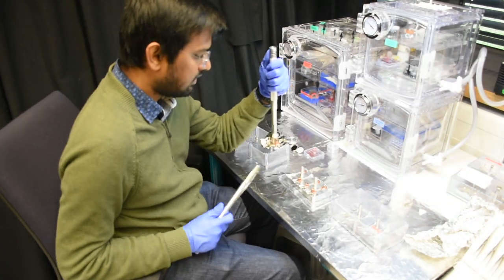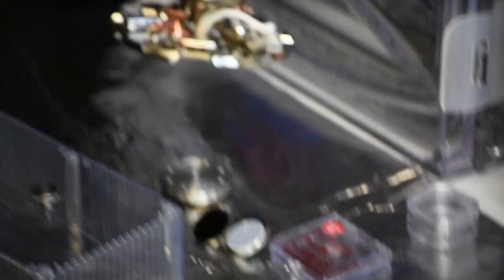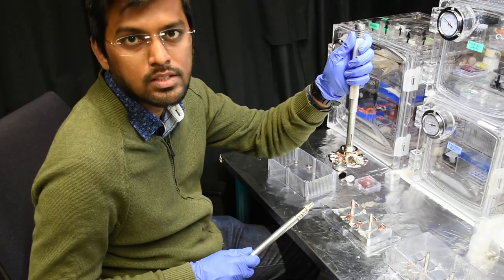This is the carousel which I was explaining to you about. We usually load our samples onto this carousel, and we load them like this using a puck manipulator. Once this sample is positioned and locked into our carousel, we load this into the load lock.